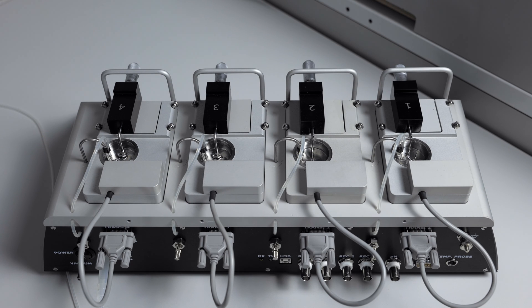If all four chambers of your DMT myograph are not bubbling, the first thing to do would be to check the gas tank to make sure that it is not empty.